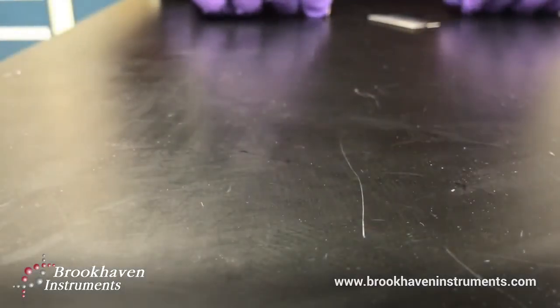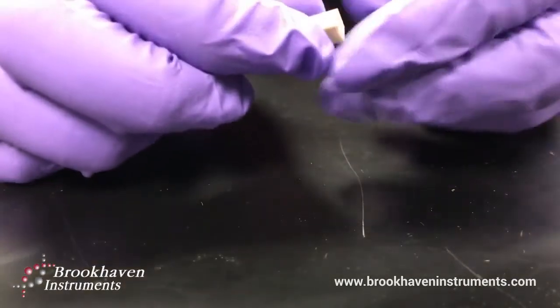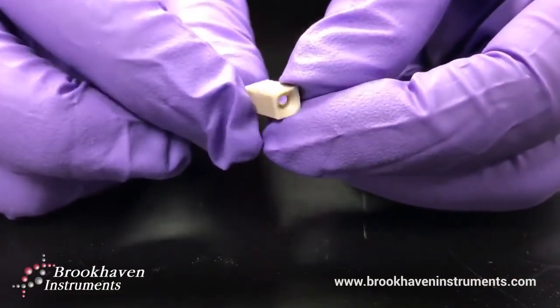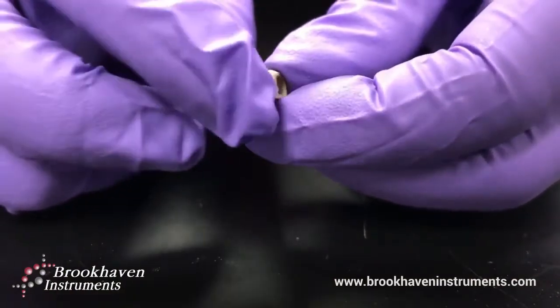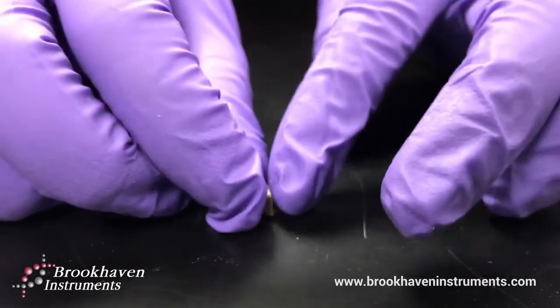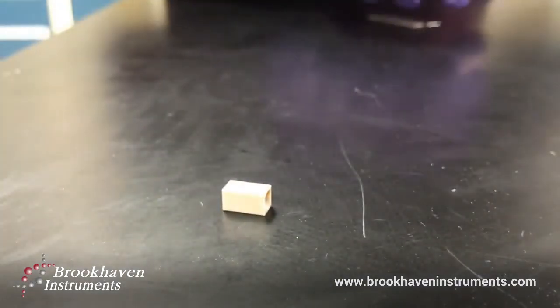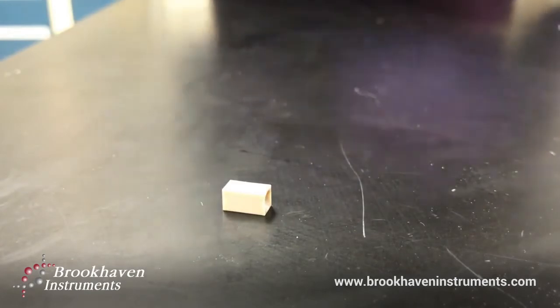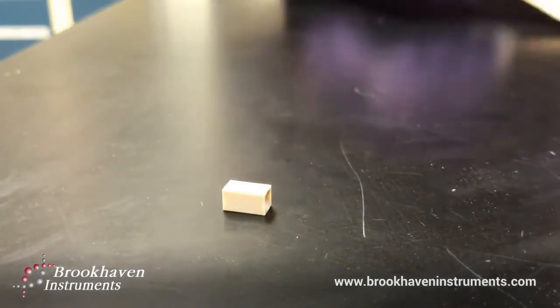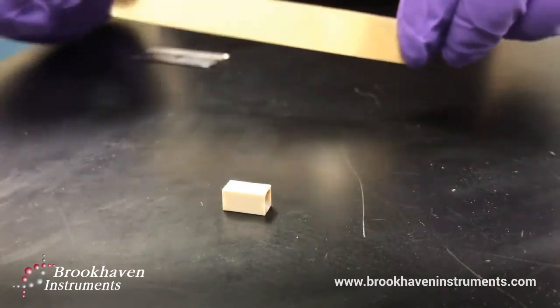To prepare for any surface zeta potential measurement, you must cut the sample of interest to size. The dimensions of what we call the substrate are 9mm by 4.5mm. For something like a membrane or film, this is one method to follow. Start with a clean, dry surface, free of anything that may contaminate your sample. Make sure to be wearing gloves as well. Make sure the substrate is clean.